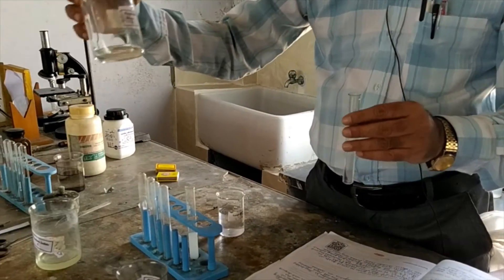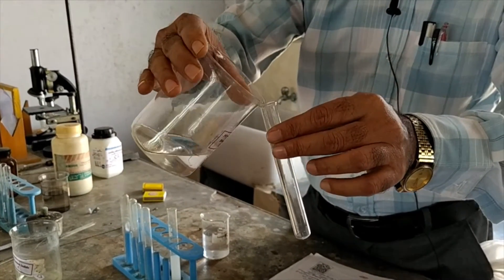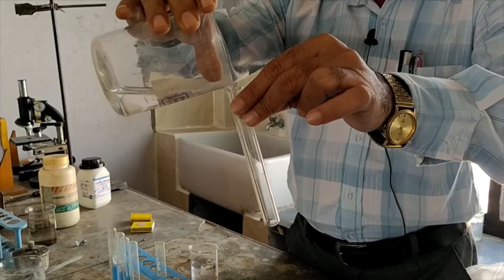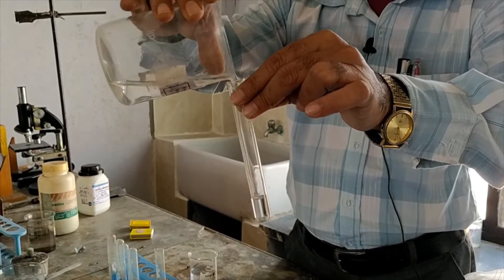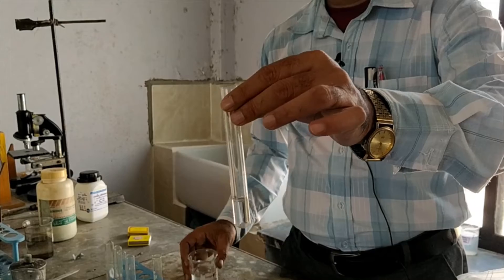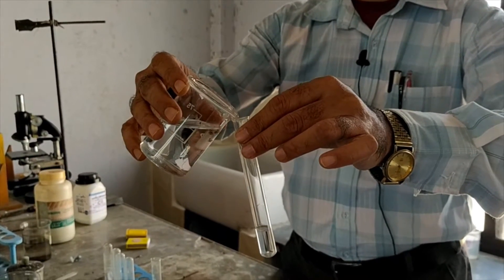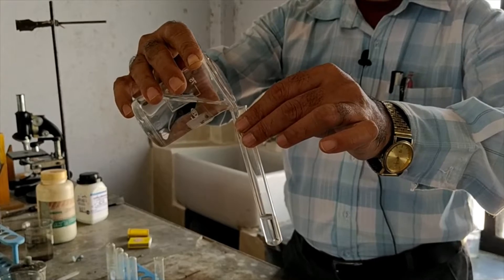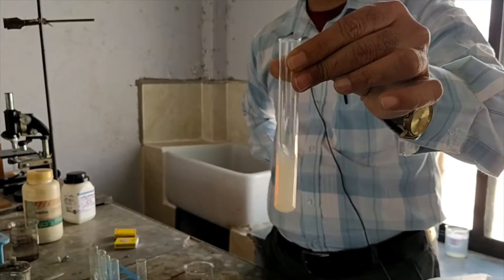Now the second solution is potassium bromide — see here, this is potassium bromide. Now observe it carefully. Pour a small amount of AgNO3, that is silver nitrate, and observe the colour change.